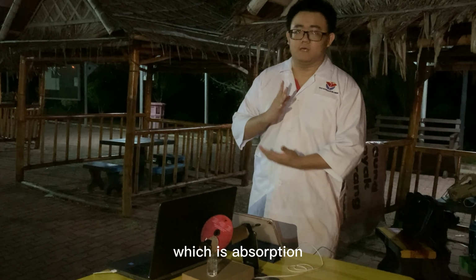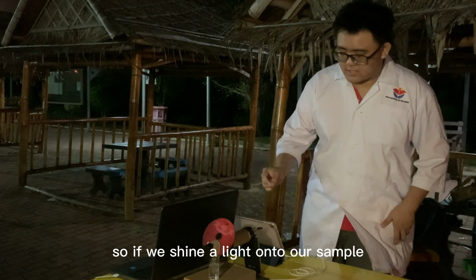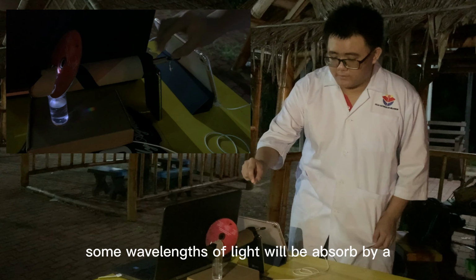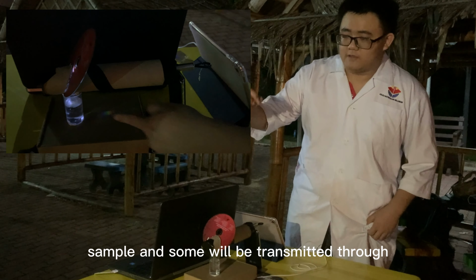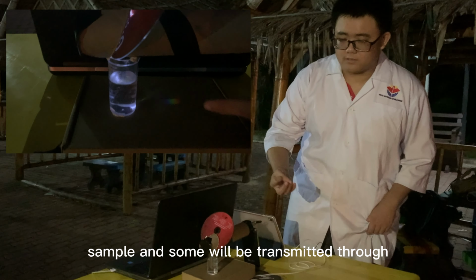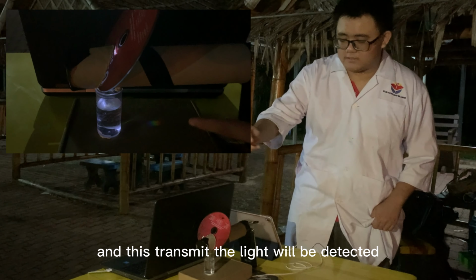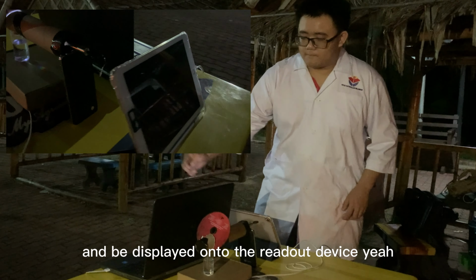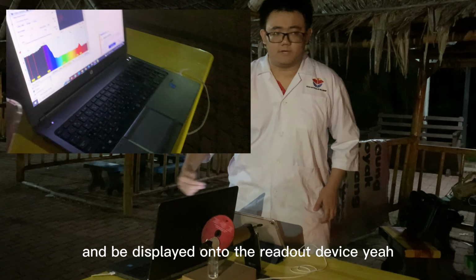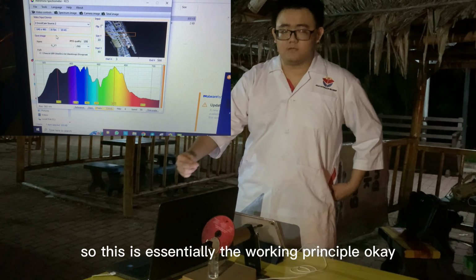Okay, so first, the working principle, which is absorption. If we shine a light onto our sample, some wavelengths of light will be absorbed by the sample, and some will be transmitted through. This transmitted light will be detected, or rather the absorbance of light will be detected and displayed onto the readout device here. So this is essentially the working principle.